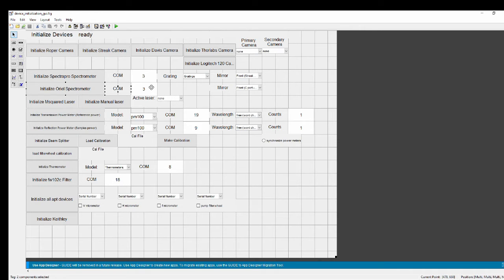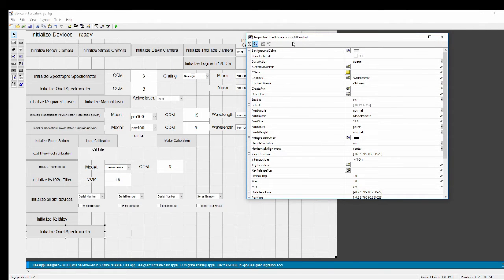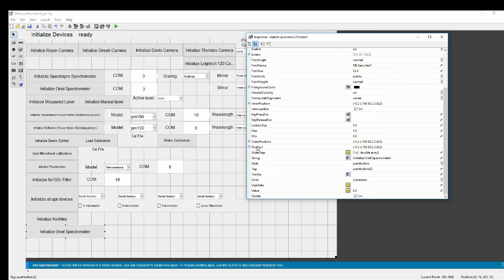So now let's see if I can get fancy. Well, I'll tell you what, I should show you how to make buttons anyway, so I won't just copy and paste everything all at once. So I'll copy, Control C, click down here, Control V, and then we're going to go into the Property Inspector. Now I've got it all listed out here what I need to name each of these, so bear with me while I look up what I've written down.